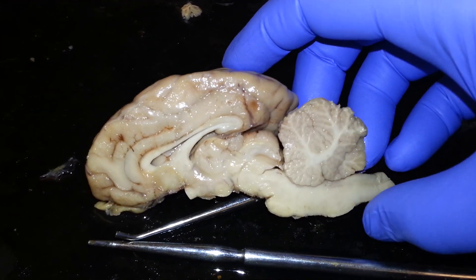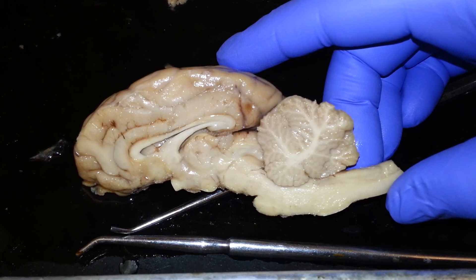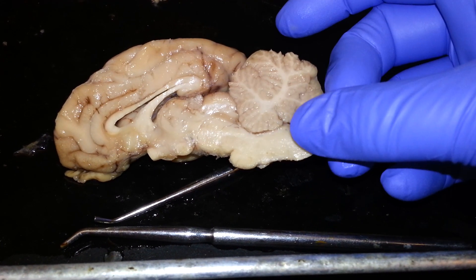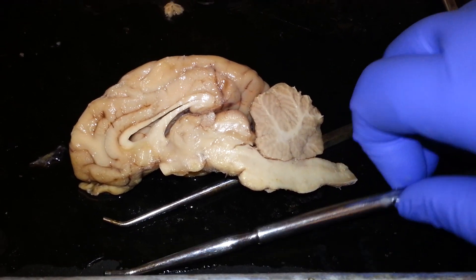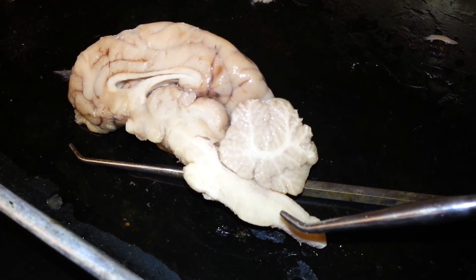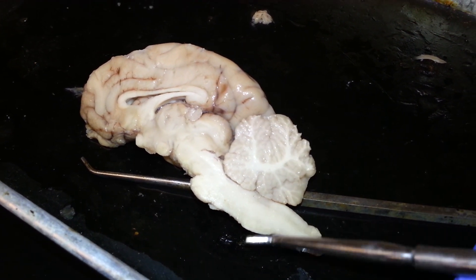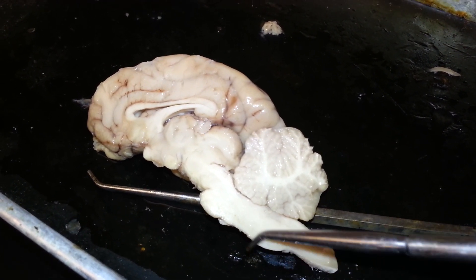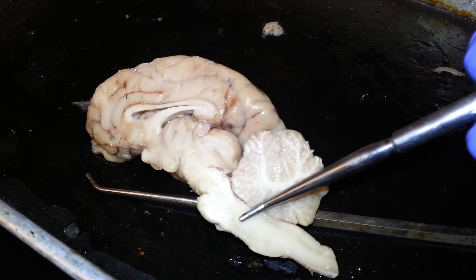Here you can see we have the right hemisphere of the sheep brain. In my hand, you can see the spinal cord. On the spinal cord, you can see that dark line — that is the central canal. You can see here that it bumps out a little bit. That first bump is the medulla oblongata.